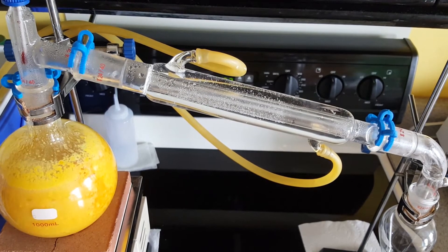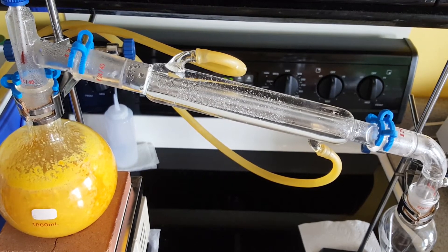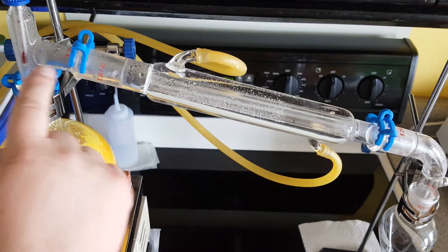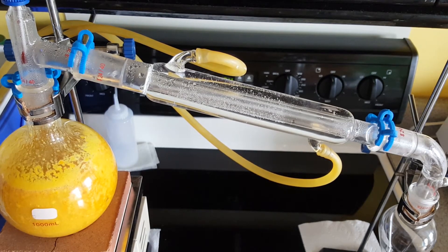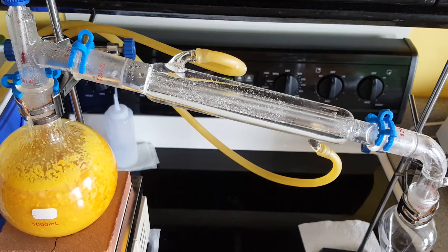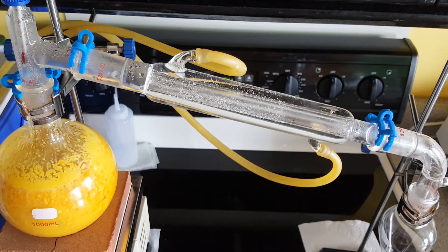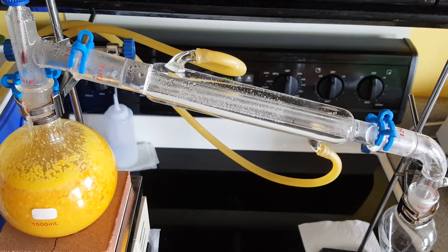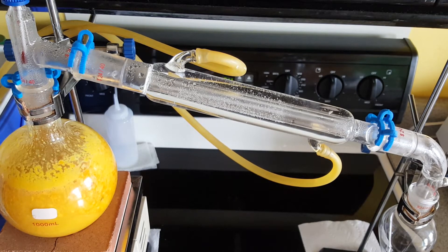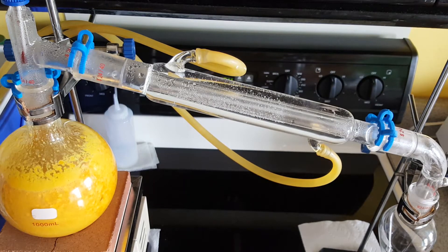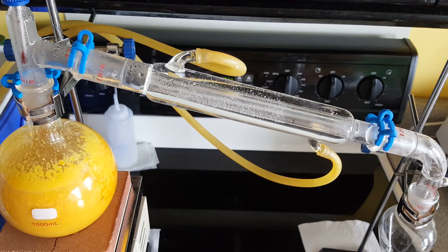A few more minutes and the temperature is reaching 80 degrees now. I see first droplets forming in the neck and dripping back down, and I think I see some vapor already beginning to form. I've reduced the heat a little bit because the liquid started boiling fairly vigorously, so I dropped the heat to slow that down.